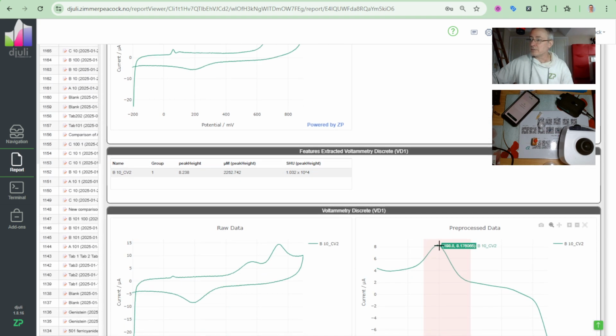And in this particular region, I think their peak height was about 10, ours is about 8, so we're about 80% their hotness. I'm going to take that sensor out, and I'm going to put a sensor in. And then what I'm going to do is actually just grab 100 microliters of that, which I will now do.